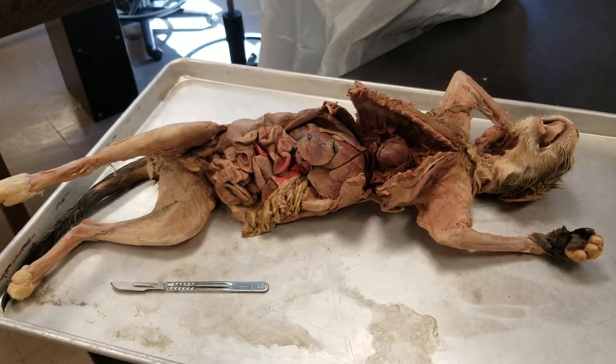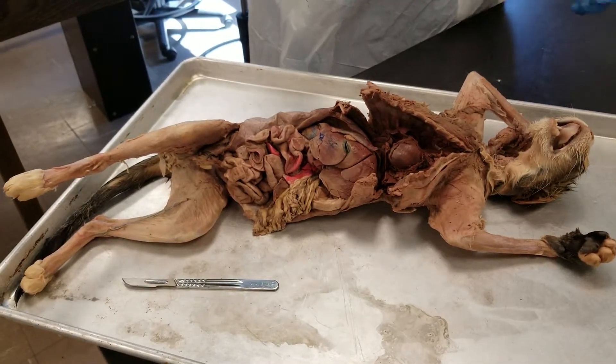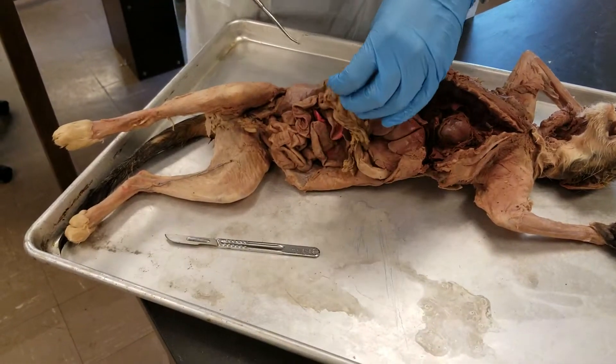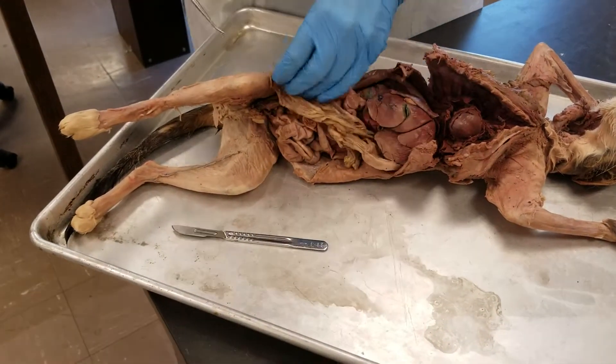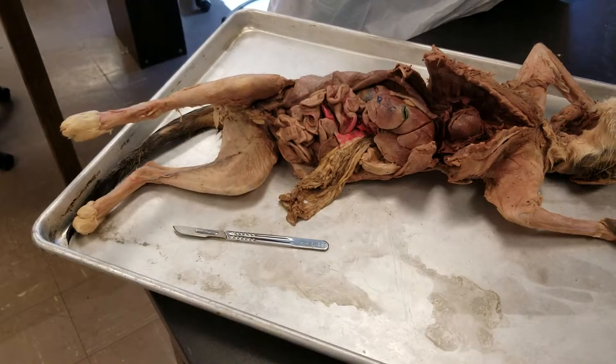Moving on to the next part, we're going to go down to the digestive system. First thing we're going to take a look at is the greater omentum, the large fatty apron that goes on top of all these internal organs.